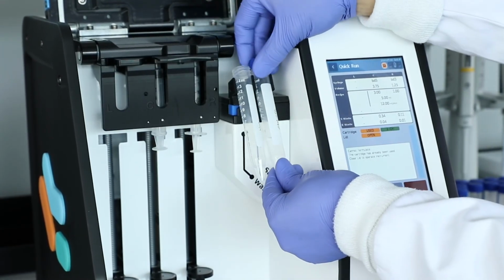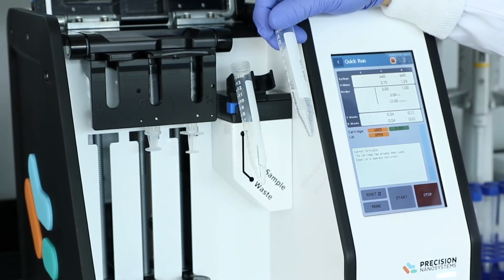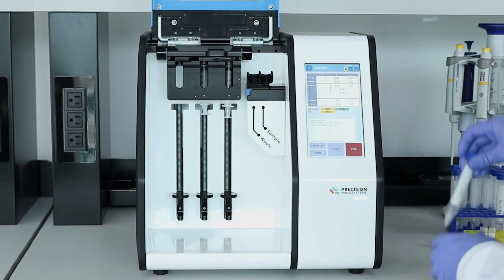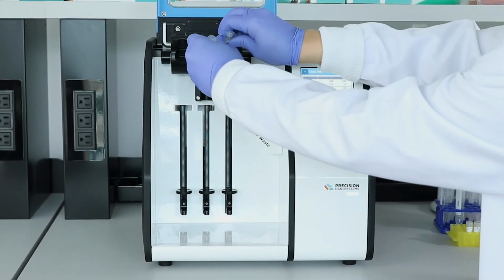The next step for this formulation is to prepare the particles for dosing. This involves particle purification by either centrifugal or tangential flow filtration, and finally sterile filtration. The ease of use, speed, control, reproducibility, and scalability make the Ignite a tremendously powerful preclinical development system.